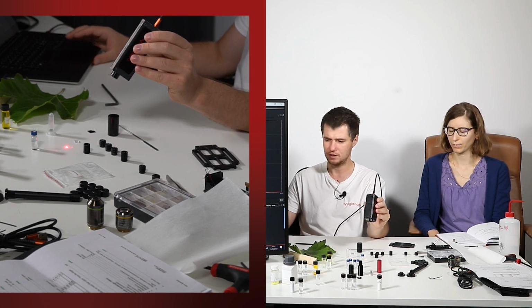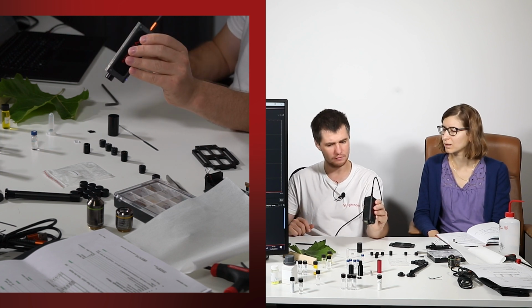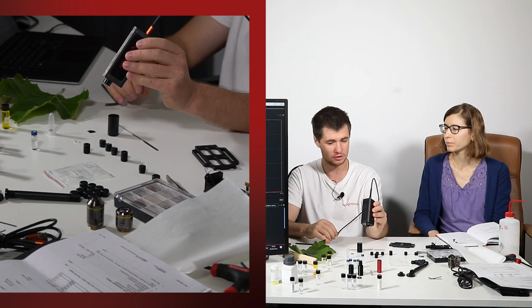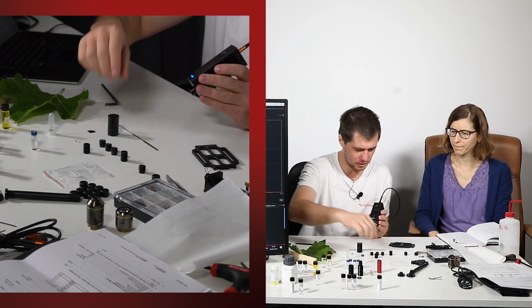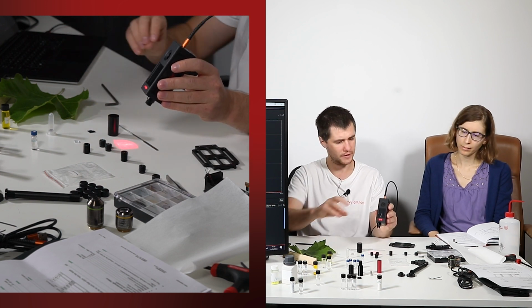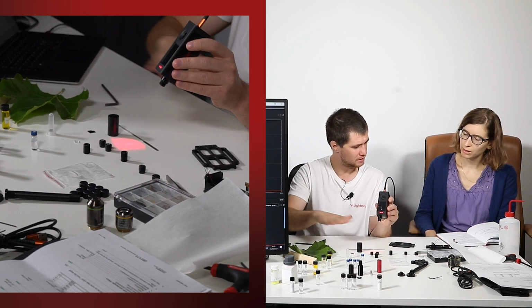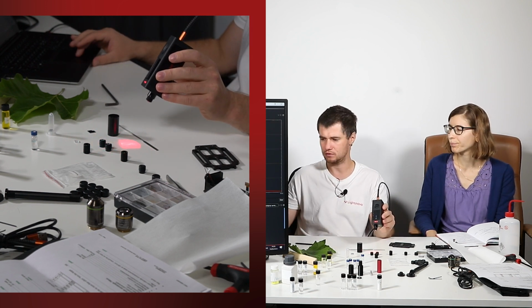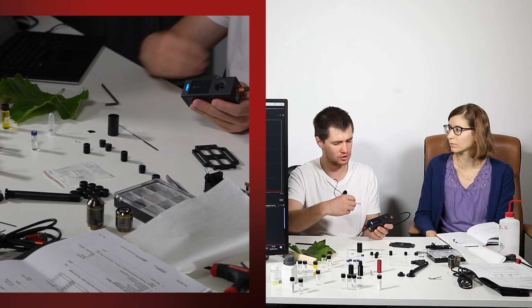There is another laser, red one, and you see it way better. They are all class 3B, which means we can look on reflection from non-mirror surfaces without eye protection, but we cannot direct into our eyes. It gets way simpler if you, of course, use some Raman probes. Then your laser spreads and power density is significantly less, so it's already more safe, of course. So it's recommended not to turn on the laser without the probe because it is more dangerous. Beam is collimated.